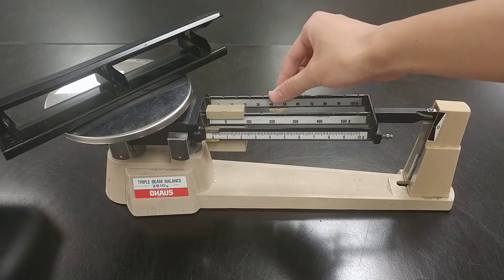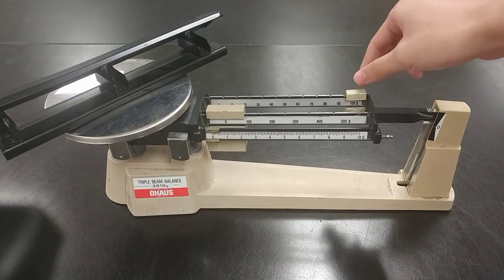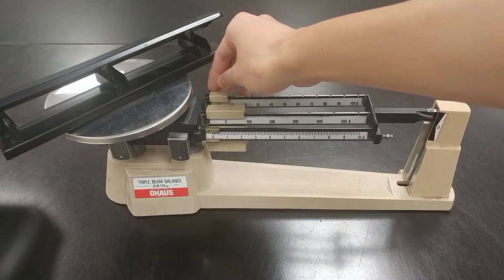So we're going to move the medium one. Nothing is happening. At the end, nothing is happening either. So we go back from that.